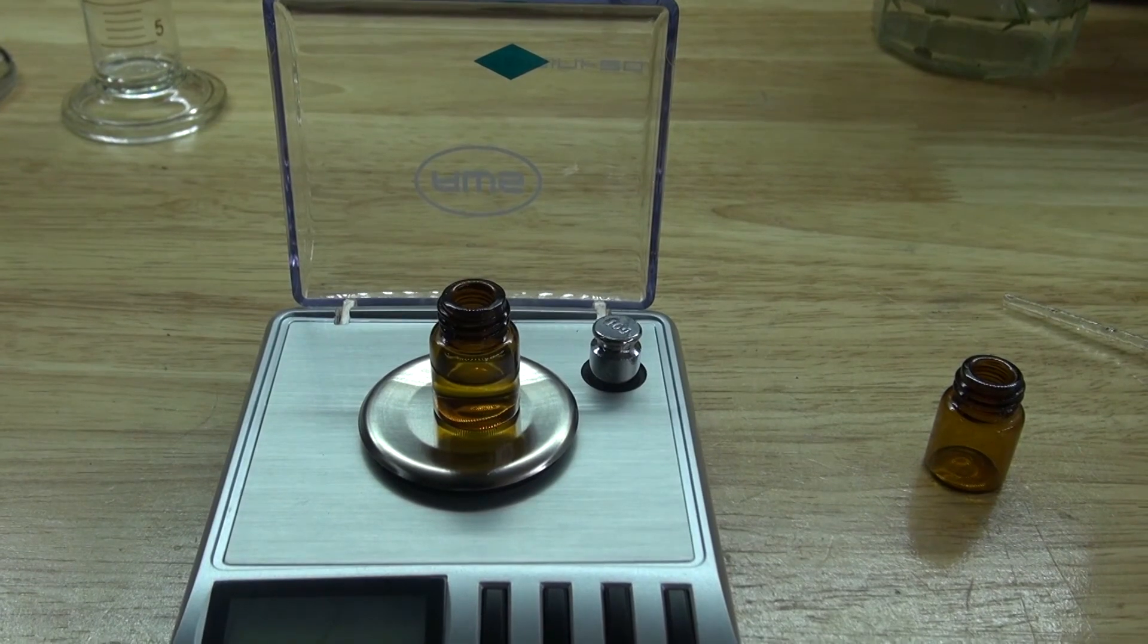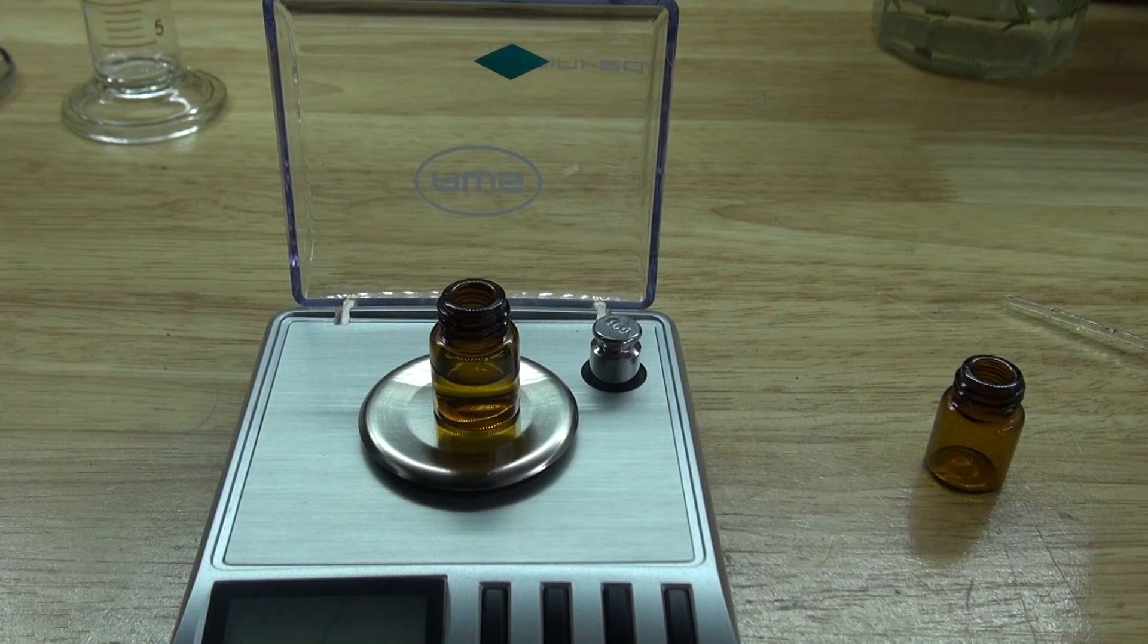So if I'm extracting 50 grams of fresh rosemary, this is what kind of result you will get. And there you have it, now you know how to make rosemary essential oil and rosemary hydrosol using a simple chemistry distillation apparatus.